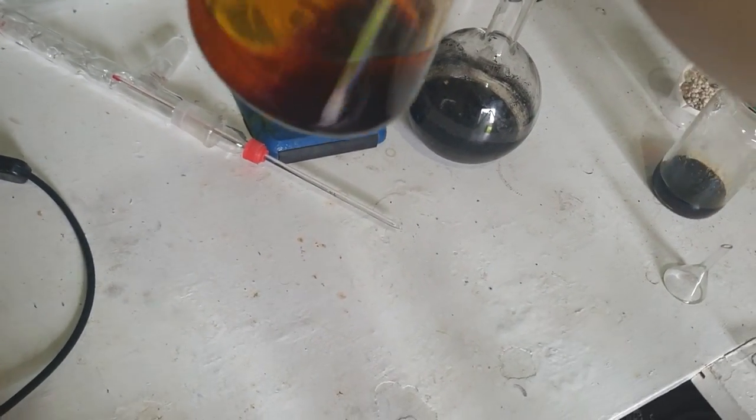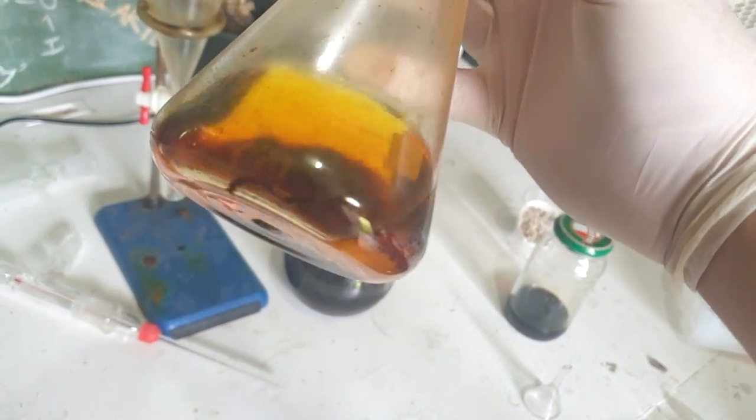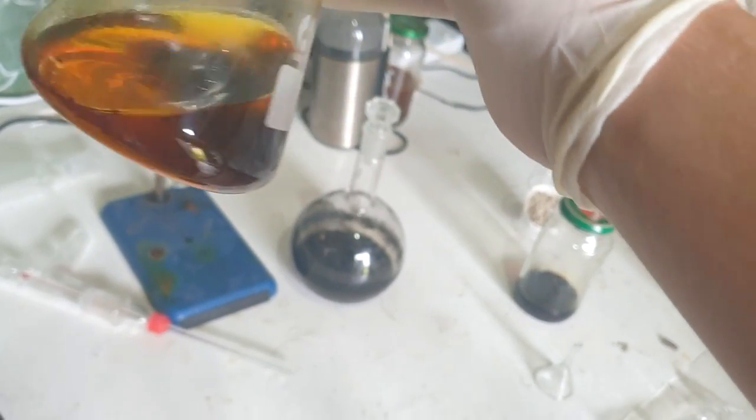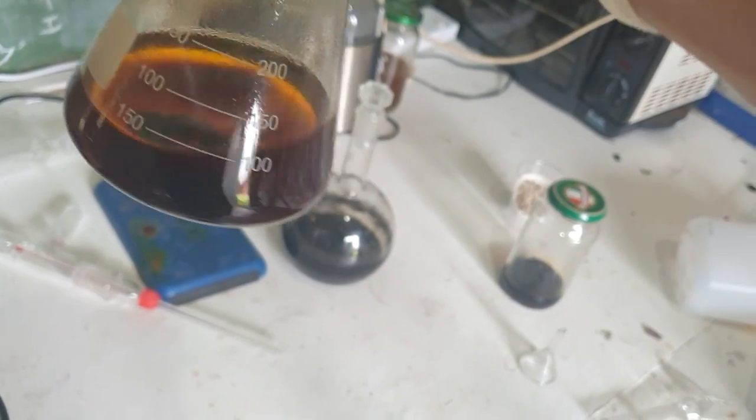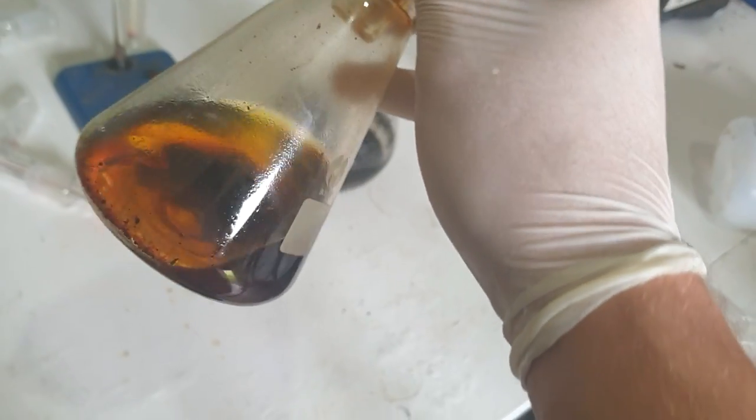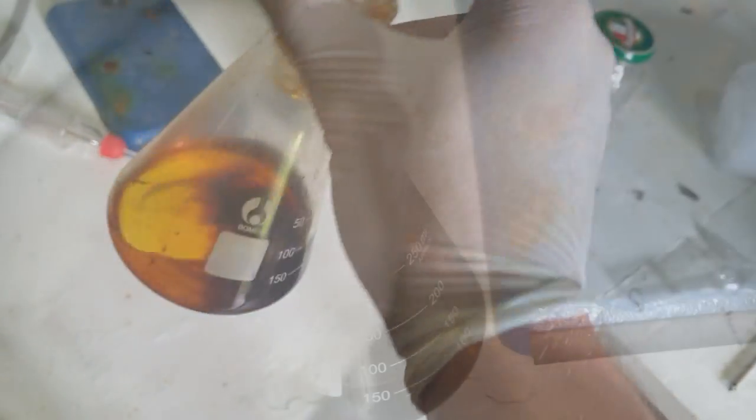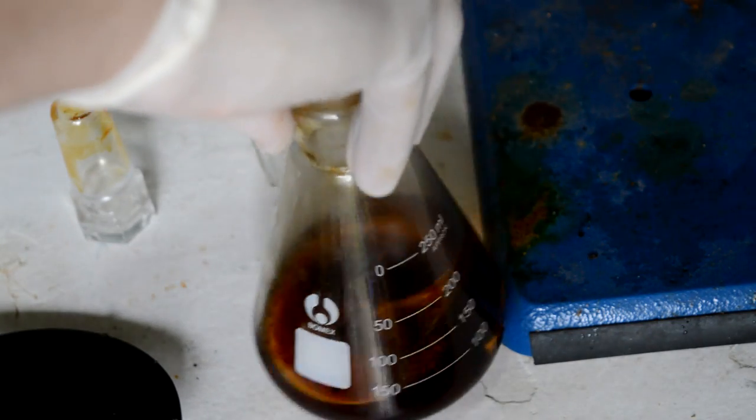Here's what our solution looks like after about a week over the potassium hydroxide. We've got some more water phase separated at the bottom. We also have this kind of solid red mass at the bottom of the flask—you can see it's sort of sticking to the walls there. This is just the impurities condensing out, polymerizing out. I think it's been useful having this another week over the potassium hydroxide to really get rid of all this stuff. We still need to distill it, and I'm fairly sure all the potassium hydroxide would have taken care of the peroxides that we know were present. But just to overkill it, I'm going to add some sodium sulfite or bisulfite to this, which will reduce any peroxides.